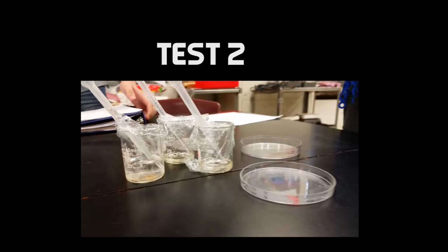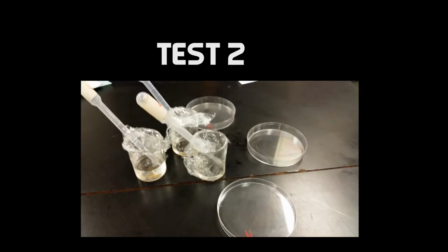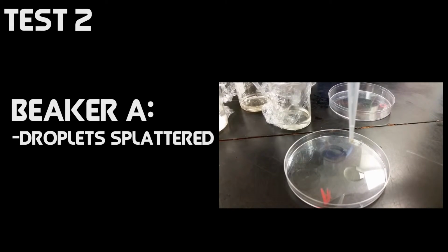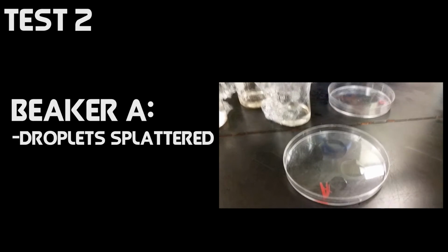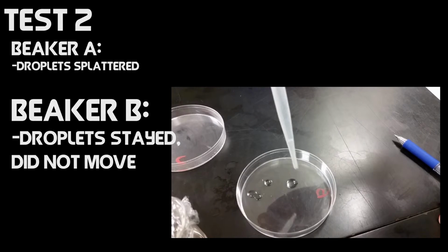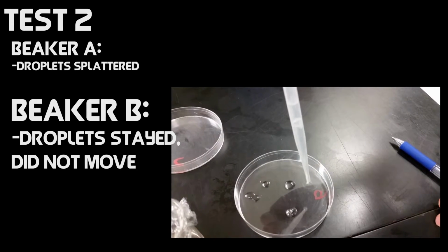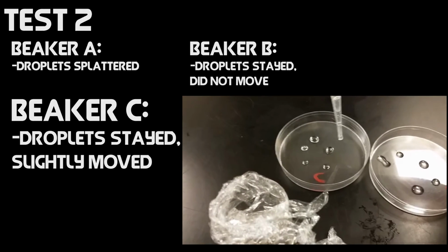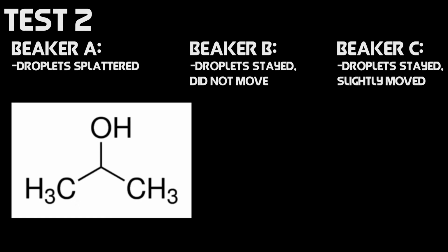The second test was conducted by observing the surface tension of the same substances on plastic plates. To further our understanding of the surface tension, we tilted the plates to see what would happen. For beaker A, the droplets did not stay together when they were dropped onto the plate. For beaker B, the droplets did stay together, and when the plate was tilted, the droplets also stayed in place. For beaker C, the droplets stayed in place, but when the plate was tilted, they would slightly move. This test further explained the surface tension of the 3 compounds.